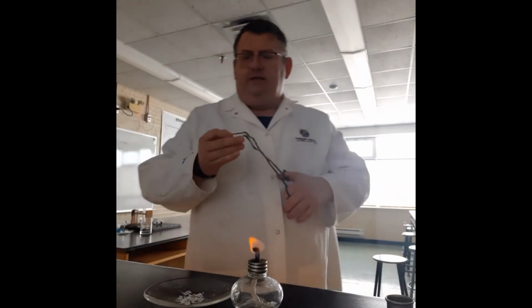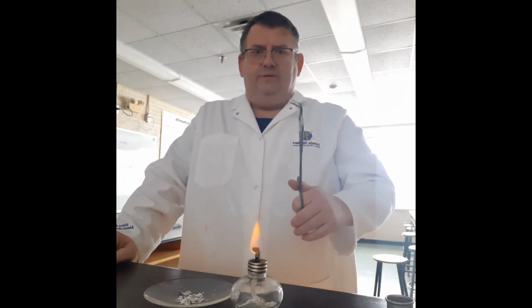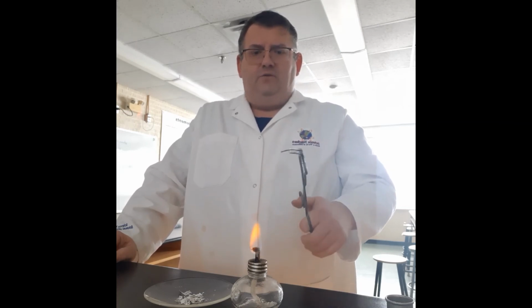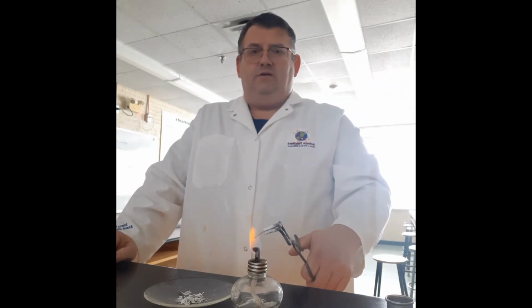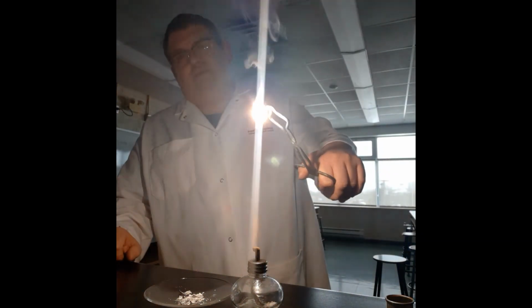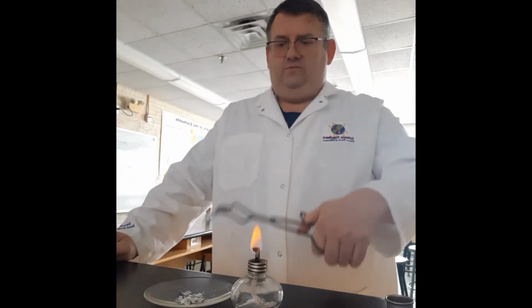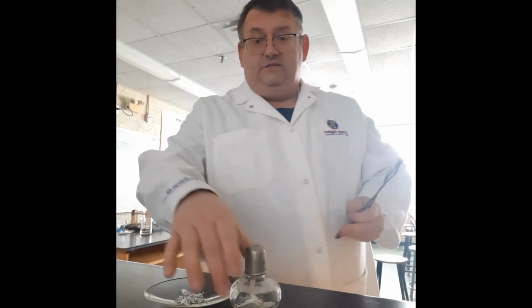We've dulled the lights here now for this one. Again, we're going to place our magnesium ribbon. Lights are off. This time we've got the magnesium ribbon, and we're going to combine it with the flame. You can see the magnesium ribbon is here. When we put it into the flame, we get a reaction. It's up to you to decide whether it's a chemical or a physical reaction. You can see here what happens as it catches. All right, we'll put that out, cover up our flame here, and that's station 5.